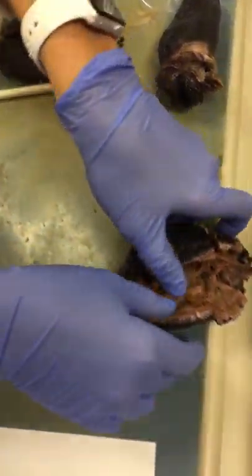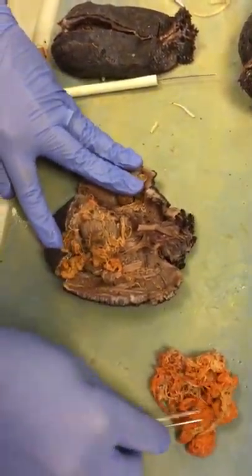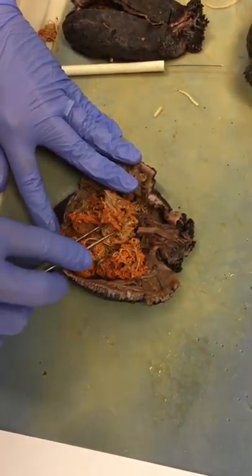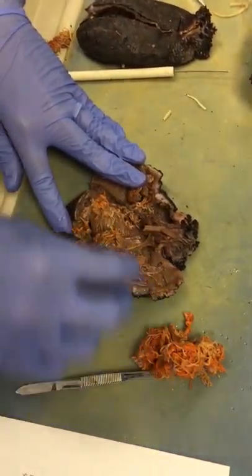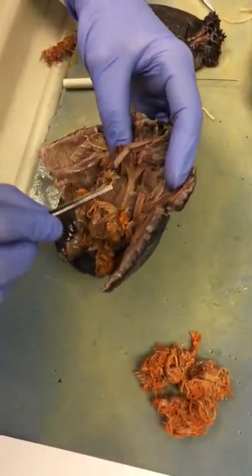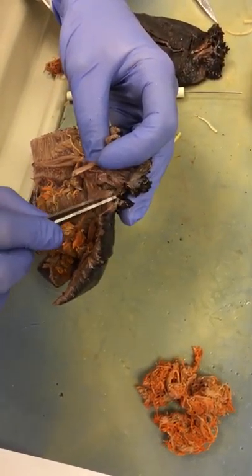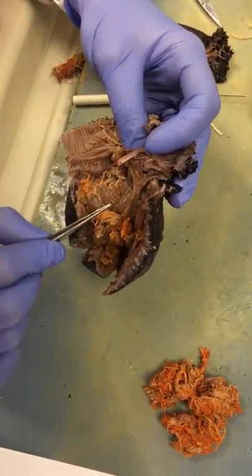We're going to take a look at this organism now that's already cut open for us, to give us an idea of what's inside. This big mass of orange — this chow mein structure — these are the gonads. Gonads are used for reproduction or the production of gametes. The gonads themselves are going to be connected via a gonadal duct, and it will lead up to the gonopore.